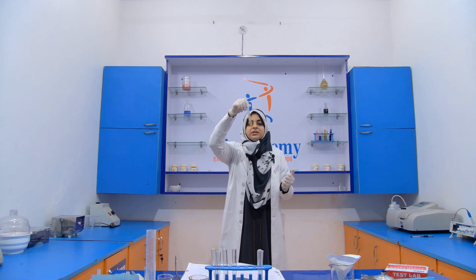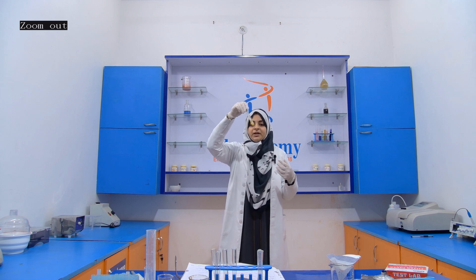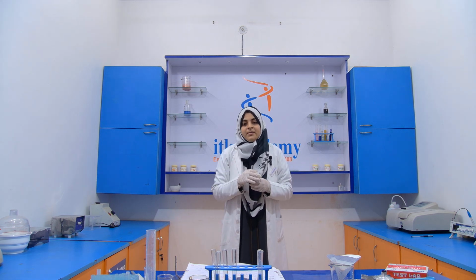So this is all about the detection of foreign resin in Asafoetida, where we get a negative result. I hope you understand.